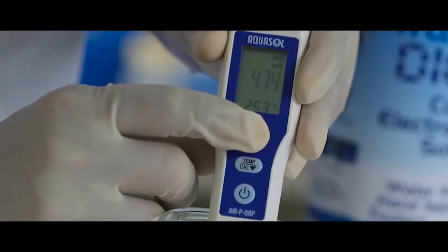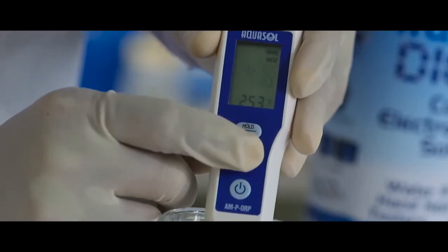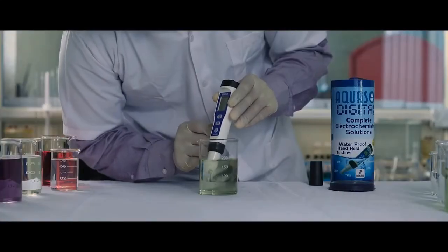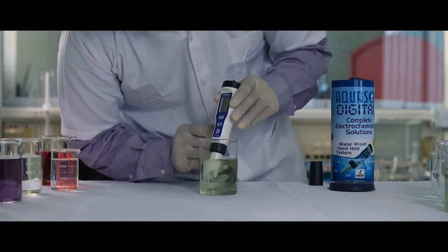Use the up and down arrow keys to adjust the reading. The meter will start flashing once the calibration is done. We can start the test.